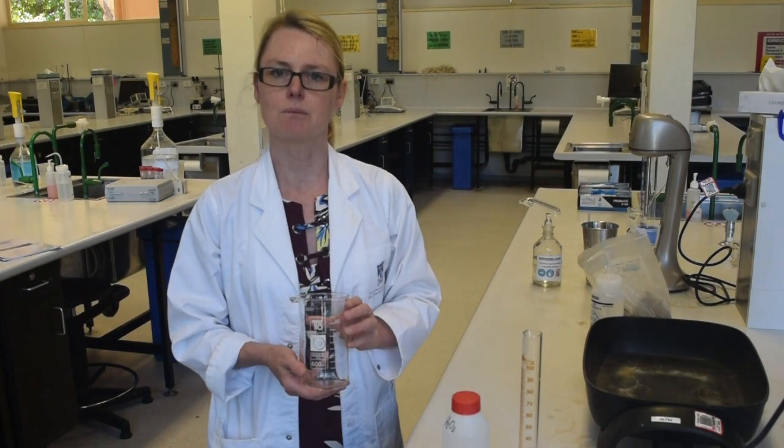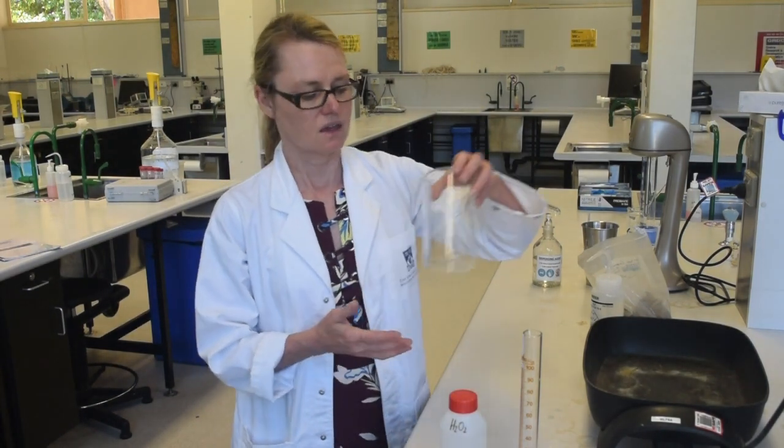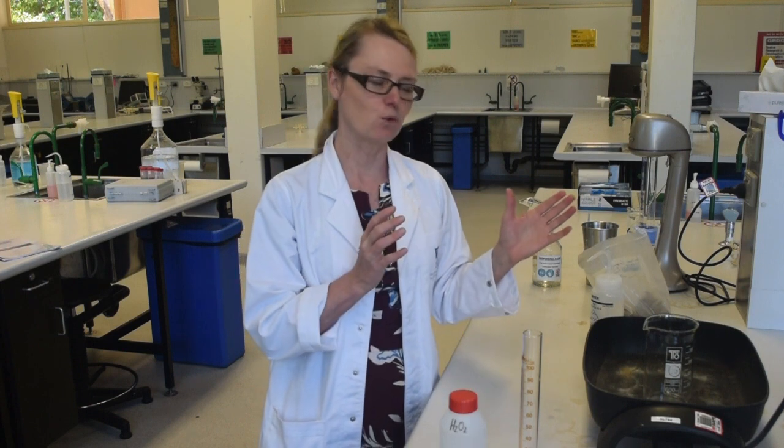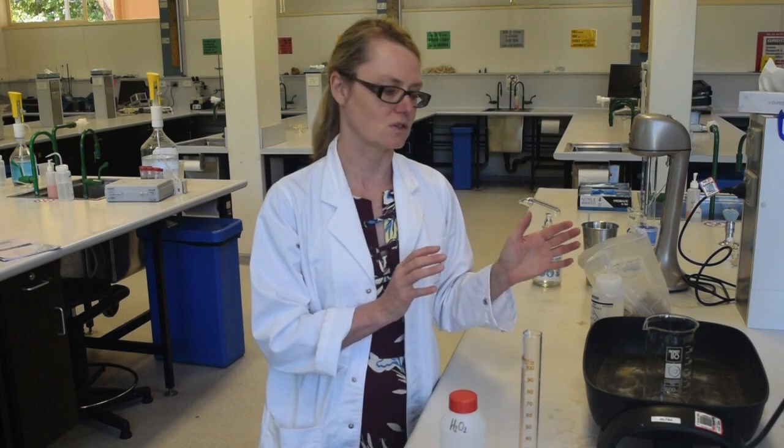You will then be taking that soil sample and placing it in a beaker with some hydrogen peroxide. This will then be placed in a frying pan — the sophisticated equipment that we have here in soil science — and you will be heating the solution to help remove the organic matter. During this phase you'll need to pay close attention to ensure that it doesn't bubble over.